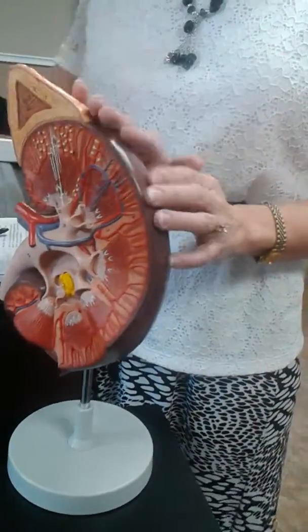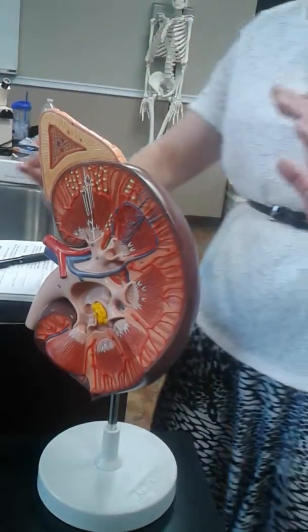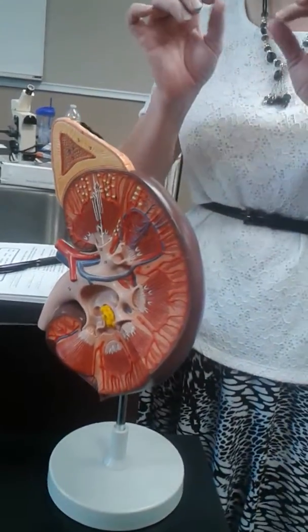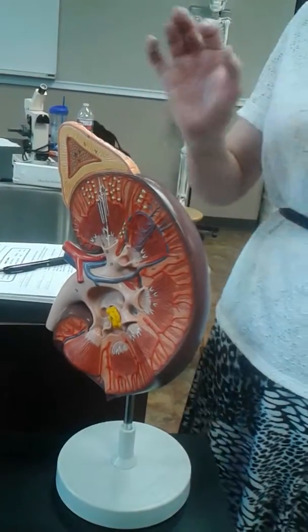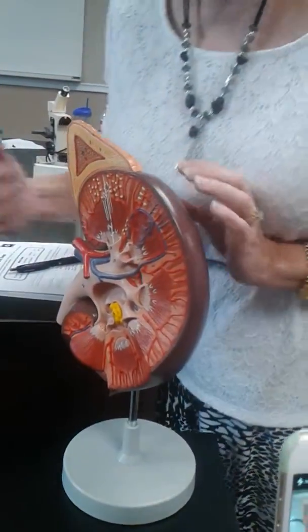Okay, so it's just that layer of epithelial tissue across it. Now, there is a covering over the entire kidney that I ask you to take a sample of and look at. That's epithelial tissue as well, but it's called the peritoneum. Don't worry about that. Just this is the capsule.